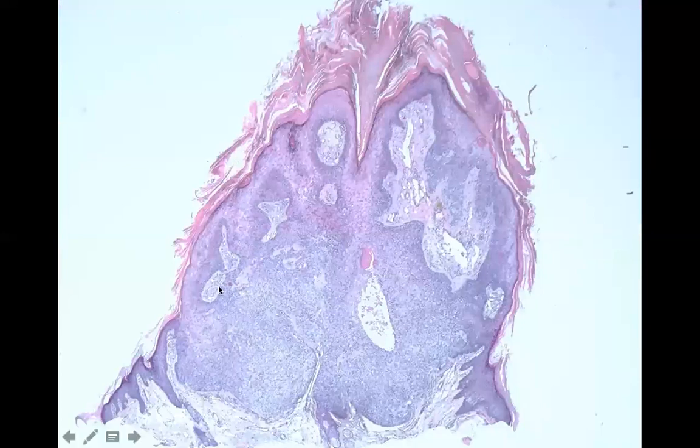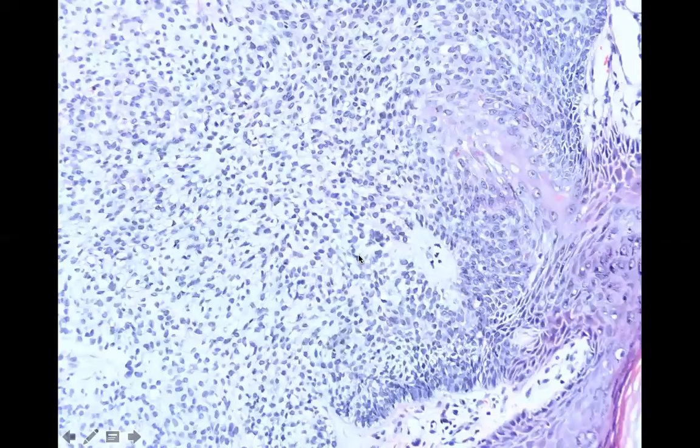This is another warty shape, right? Digitated on top, hand-holdy and curved on bottom, but this one looks a little bit different. You have these epithelial cells down here that are really pale looking, and they kind of line up a little bit like piano keys on the bottom. This should remind people of the tricholemmal portion of a hair follicle, right? So if you have a warty shape with tricholemmal differentiation, that is what has been referred to as tricholemmoma.